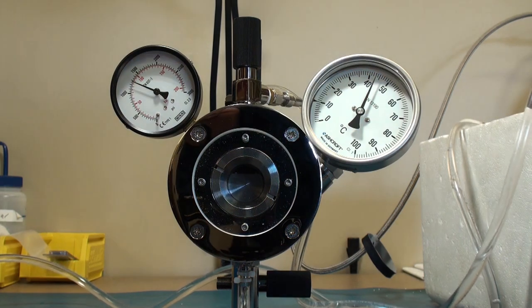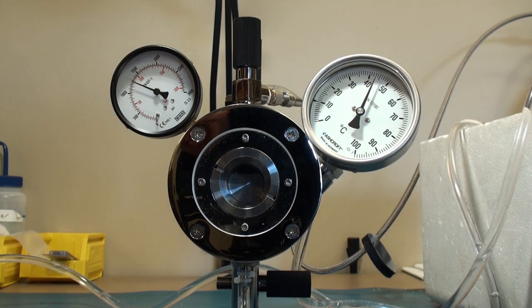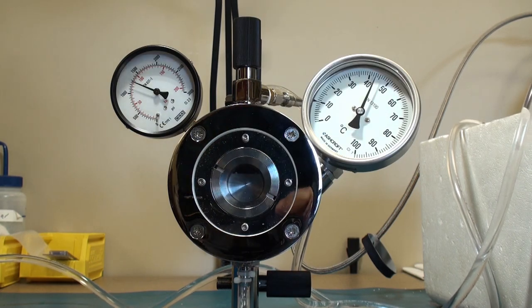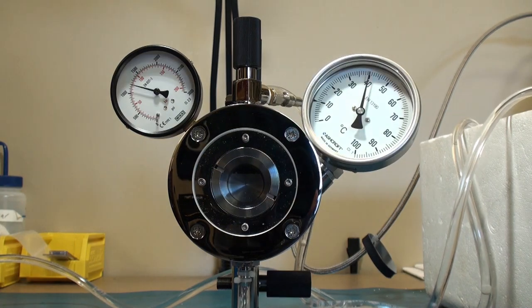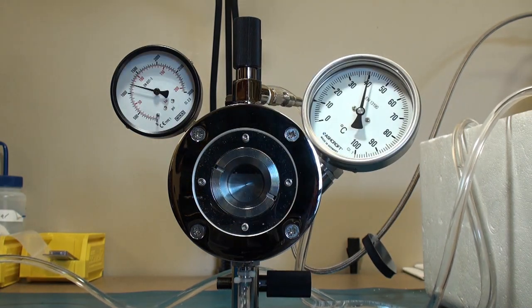So again, we're still above the critical temperature and we're slowly bleeding off pressure. And we'll rejoin this in a while. Okay, as you can see, we're approaching the critical pressure level again on the downswing, slowly venting.